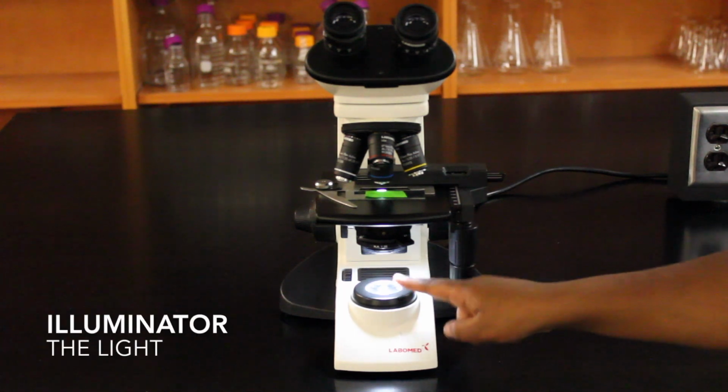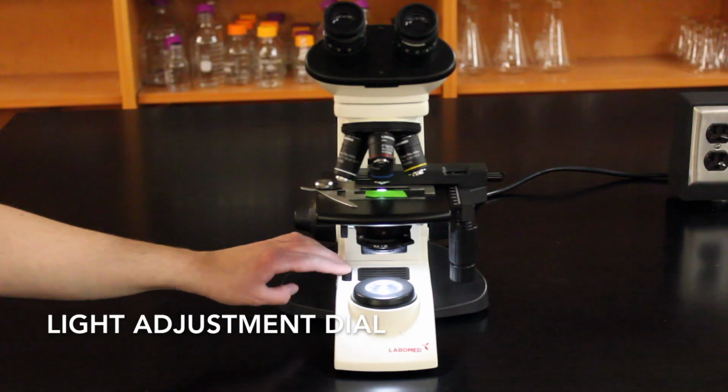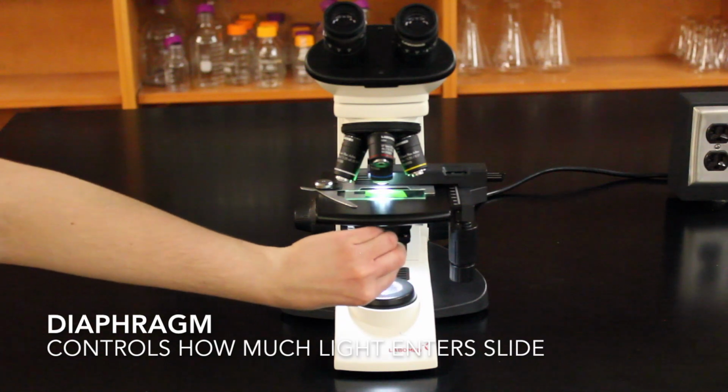The illuminator is the light at the bottom of the microscope, while the light adjustment dial controls the brightness of the illuminator. The diaphragm controls how much light enters the slide.